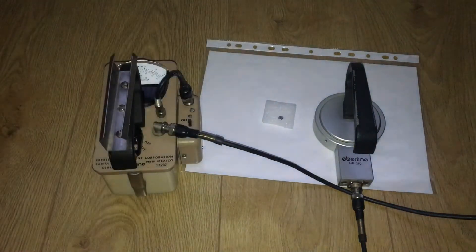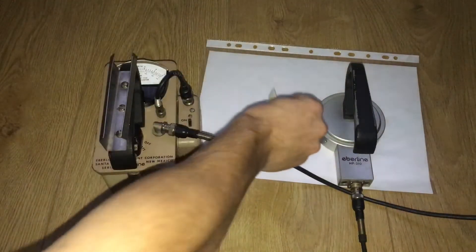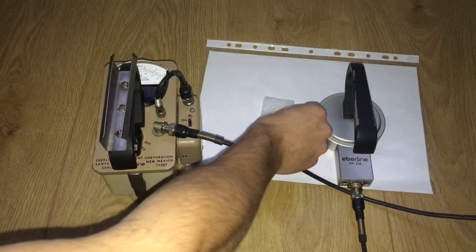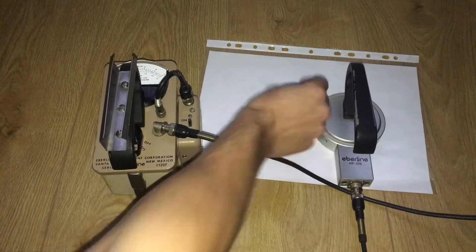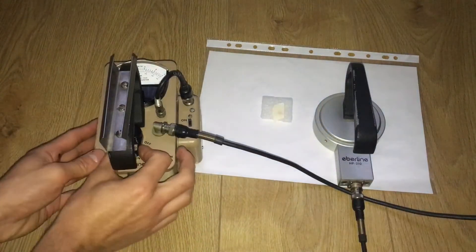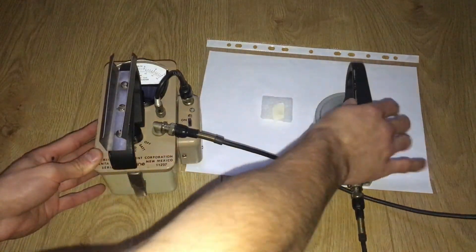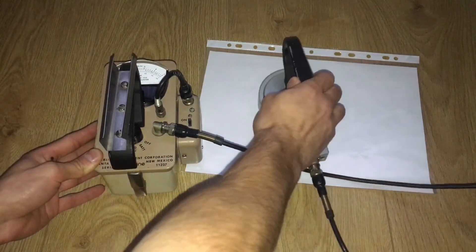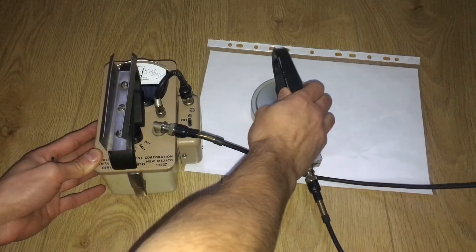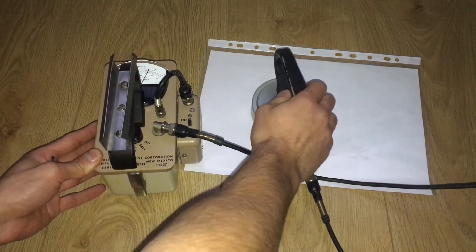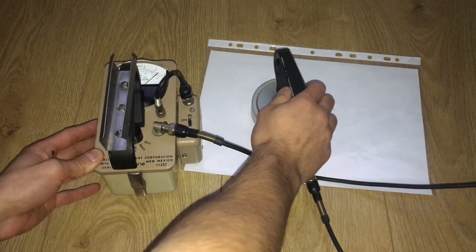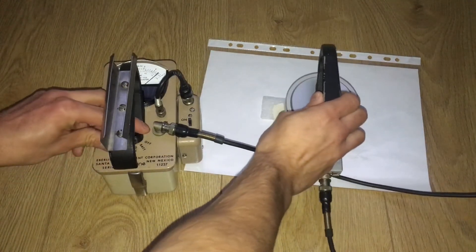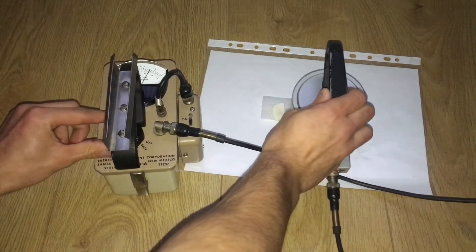So I put it on, and now you're just going to be measuring gammas. Times 1.